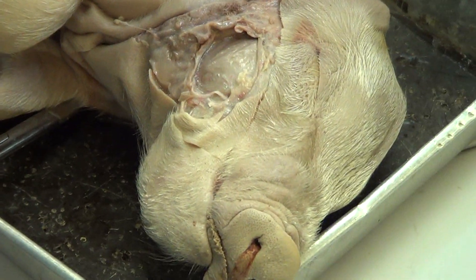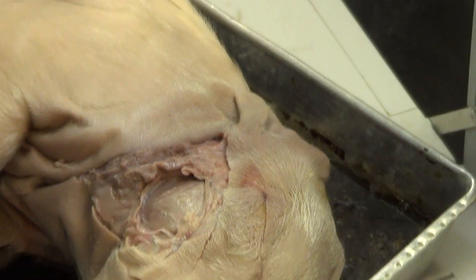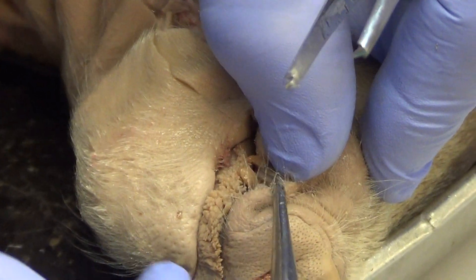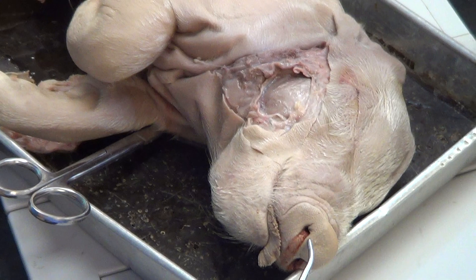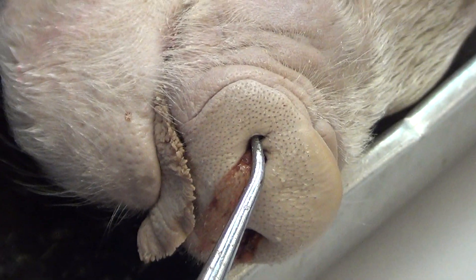You don't have to dissect anything for teeth. All you have to do is know that for most of your pigs there will be a little canine sticking out right in the corner of the mouth, so you'll draw that into your picture. Remember, canines are involved in shredding and tearing. You just have teeth for now. External nares — right here — for breathing, air in and out, and for smelling.